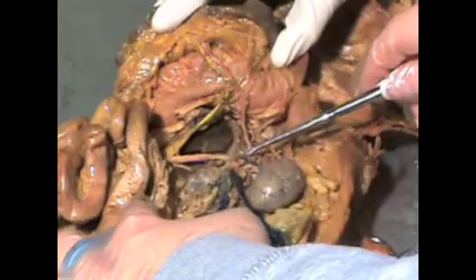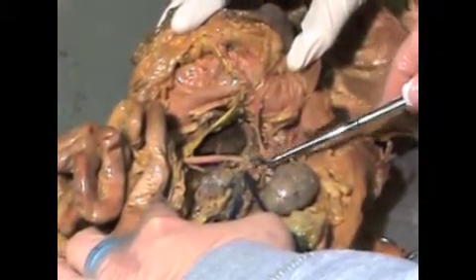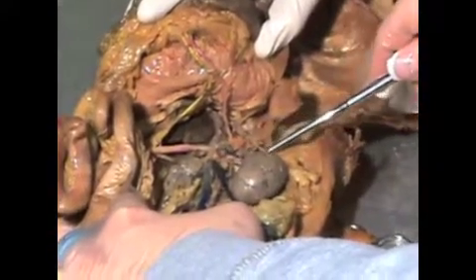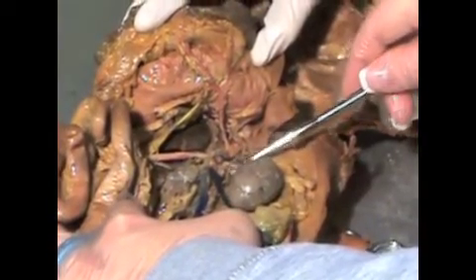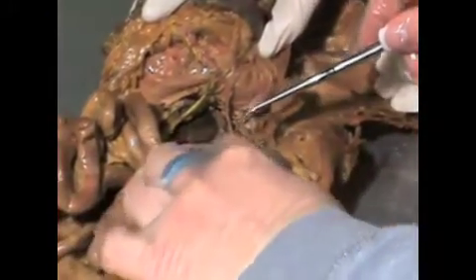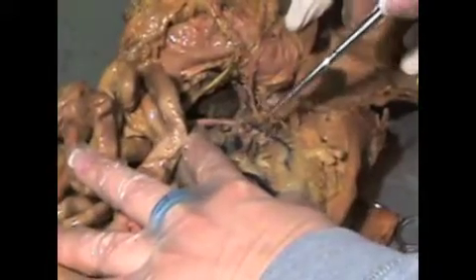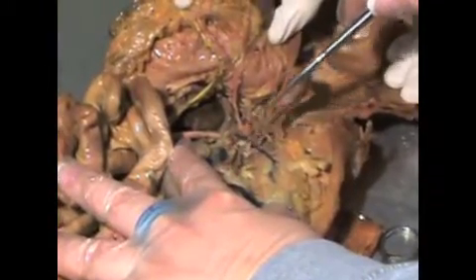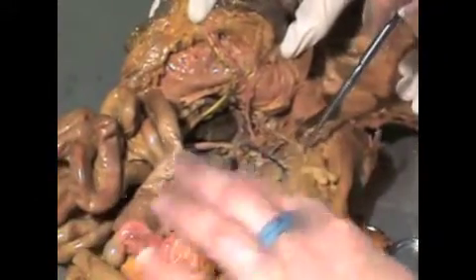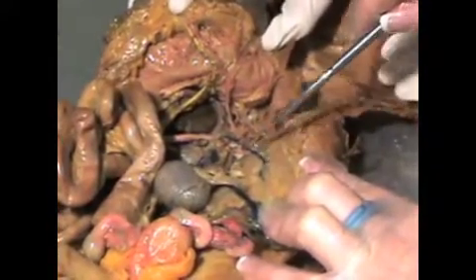Moving back to our abdominal aorta, we're going to locate our adrenal gland, which is seen here. The next branches we're going to look at off of the abdominal aorta are the adrenolumbar arteries. Lying on top of the adrenal gland here, you can see the adrenolumbar vein. The artery lies beneath. If we reflect the kidney back, we can better see these vessels. So the adrenolumbar artery and vein feed out into the dorsal body cavity wall and serve the lumbar region as well as the adrenal glands.